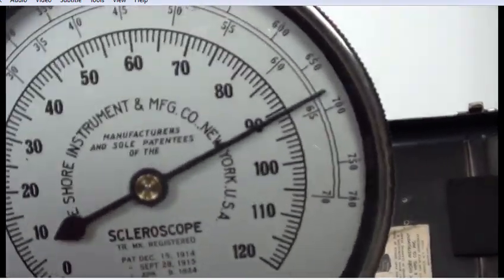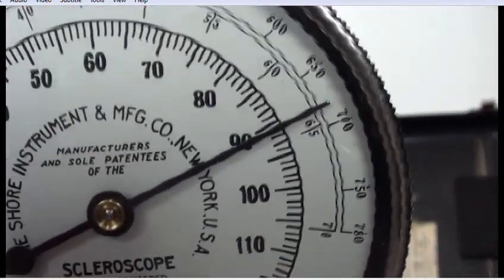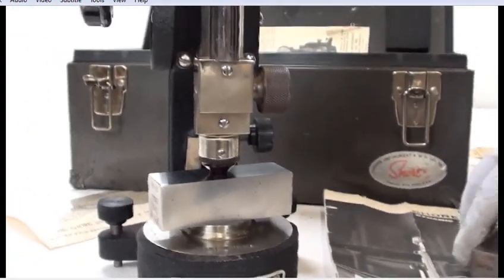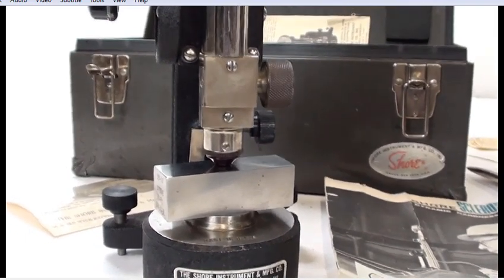And it comes in at 90. That's pretty close. But we've done this many times, so we may have hit the same spot twice. Perfect.